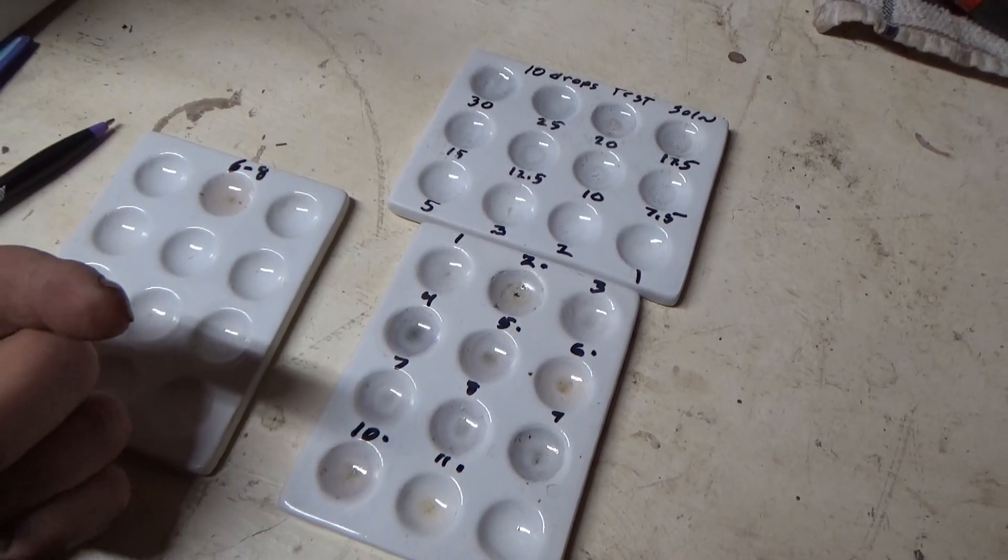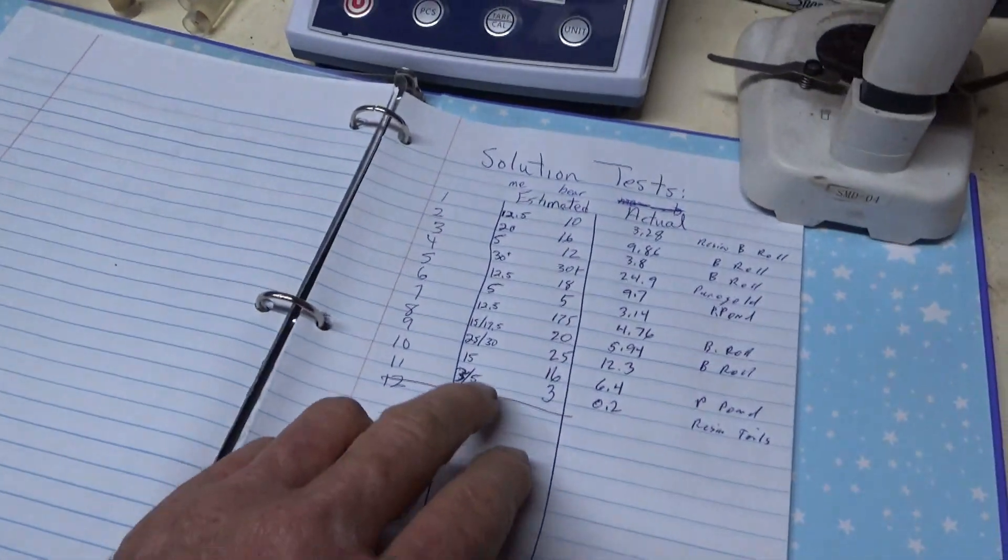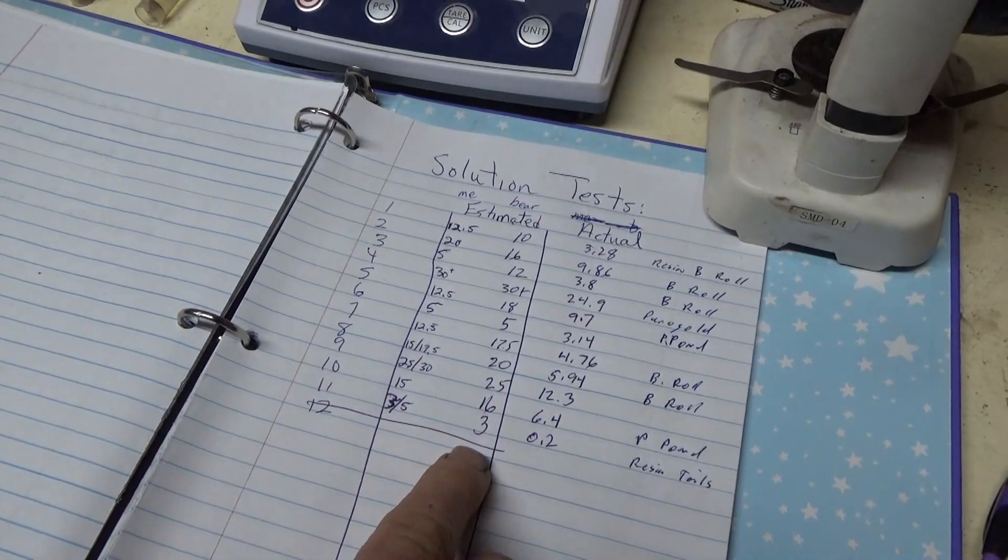It's going to be warmer, it's going to occur faster. It's kind of hard to tell why, but when we come over here, Eva estimated the concentration here, I estimated it here, and then here's the actual there.